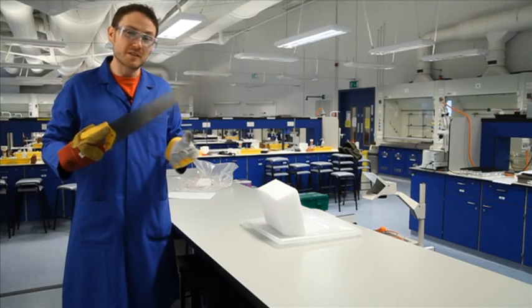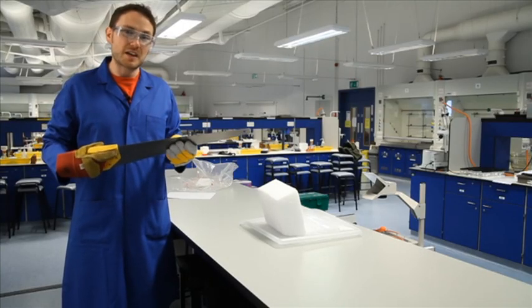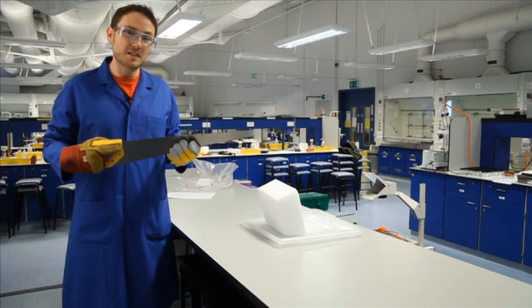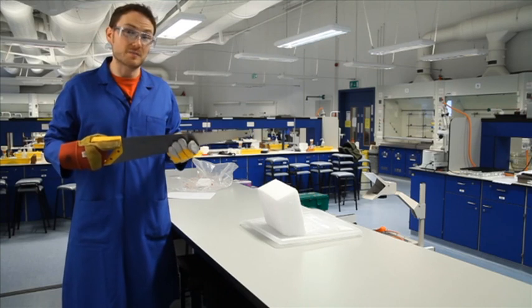A regular wood saw will be able to cut through the block, but you've got to be patient because they're quite brittle. The last few centimeters will be hard going, but don't rush it too quickly, otherwise you may risk breaking the block.